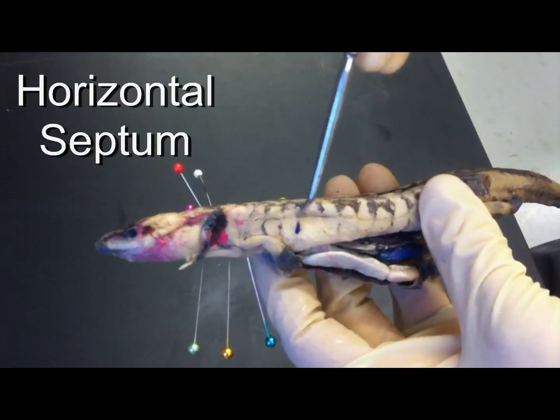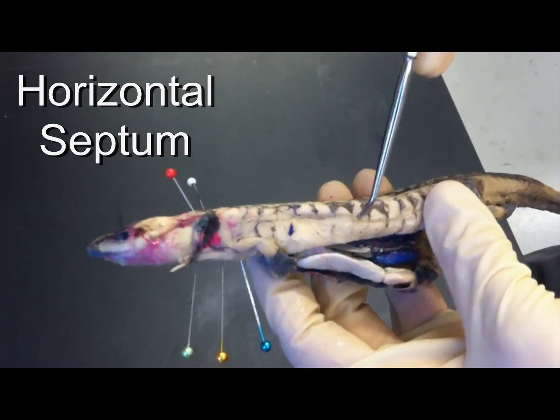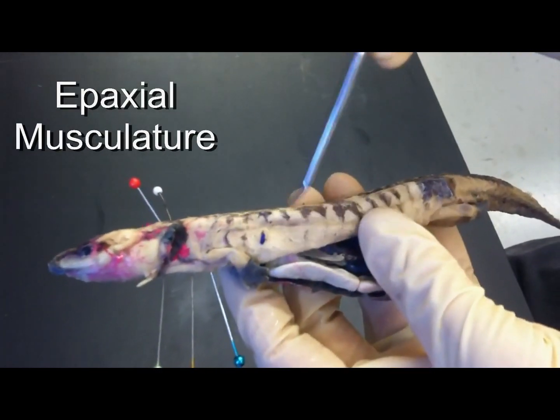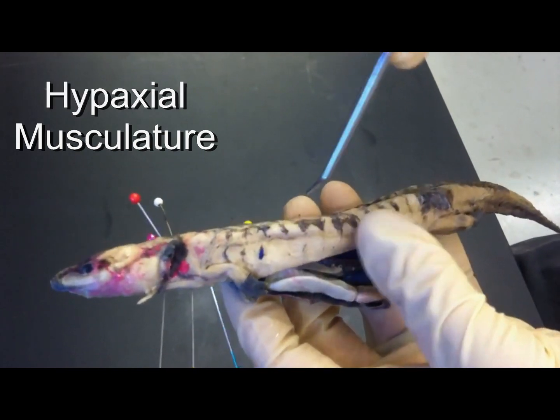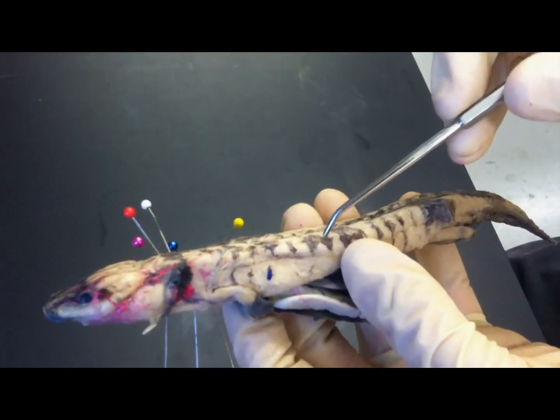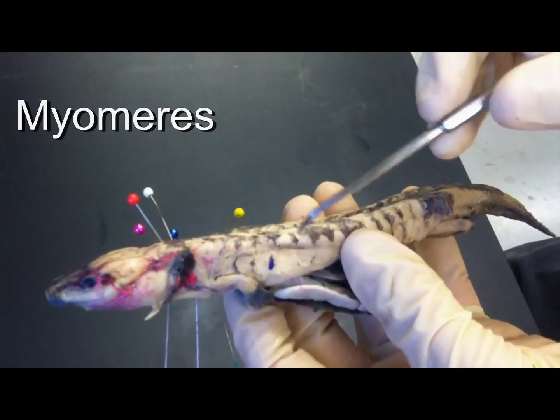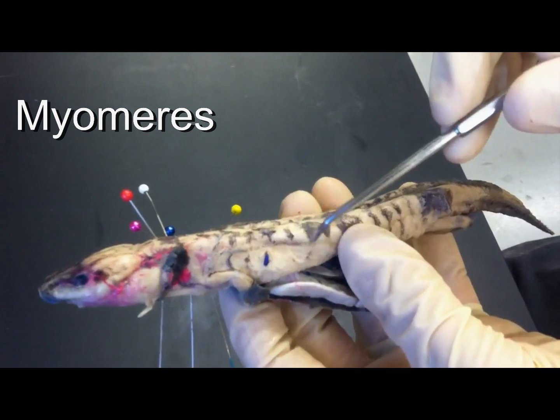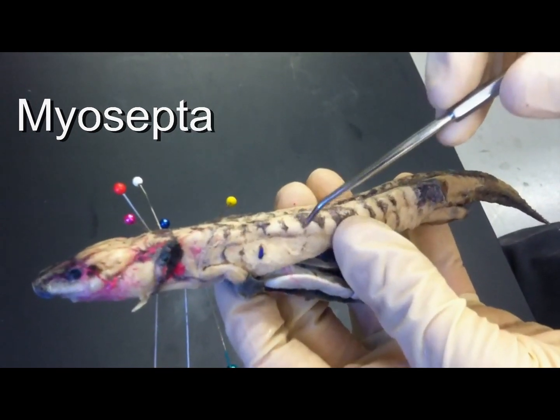First you have the horizontal septum, which separates your epaxial musculature from your hypaxial musculature. You can see that these are repeating segments of muscle. The muscle parts are the myomeres, and then the lines in between them are the myosepta.